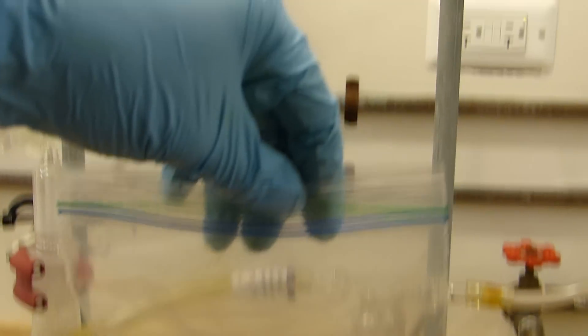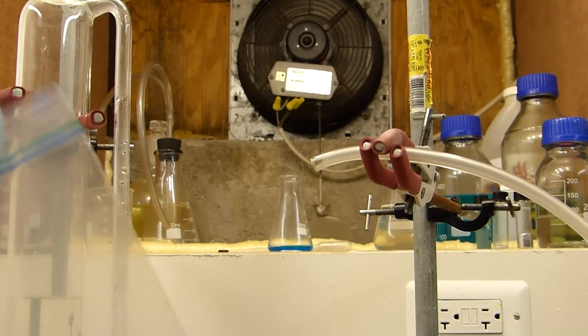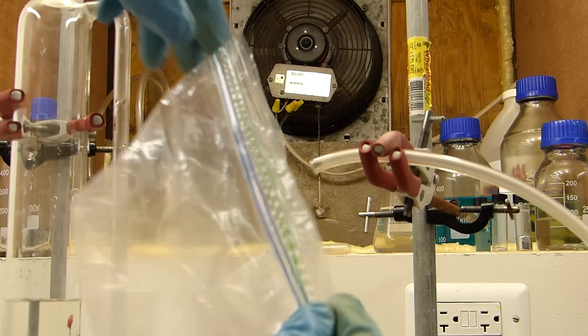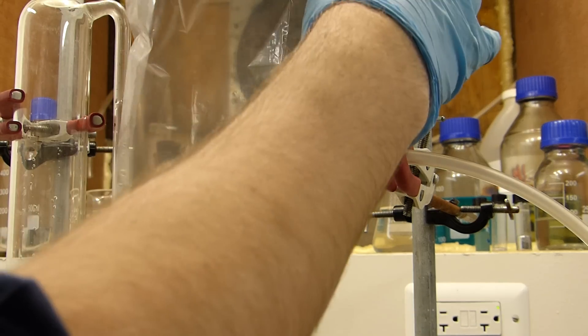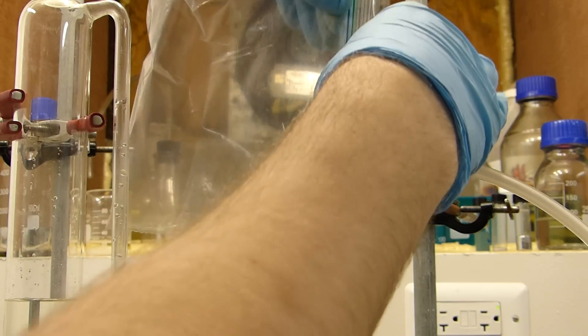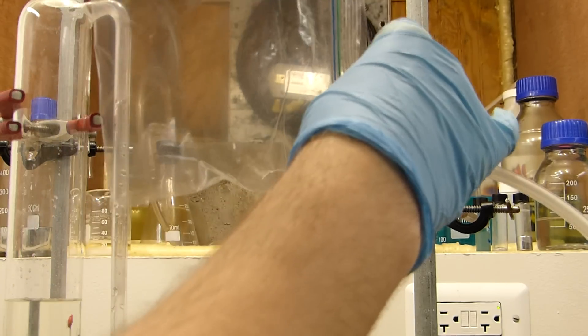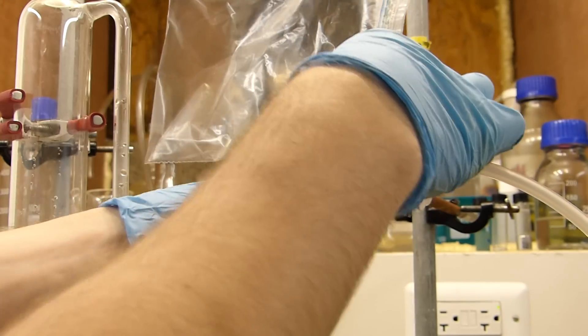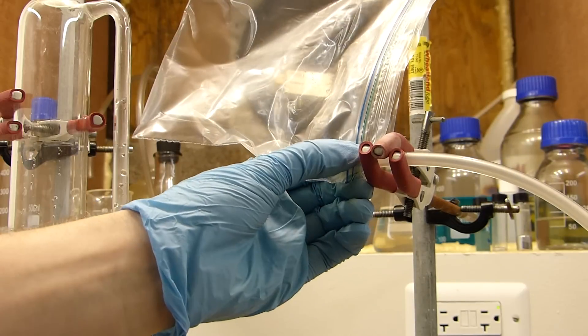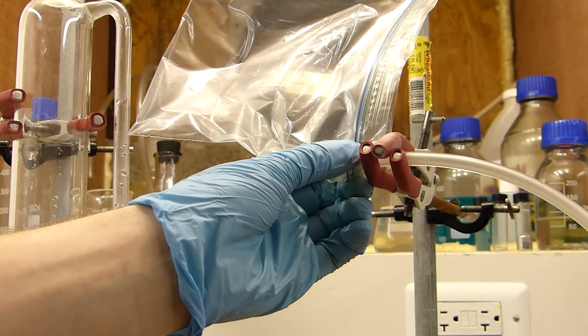All right, so I'm going to try and make a hydrogen filled sandwich baggie and see if it'll float. Now hydrogen is much more buoyant than air, in fact it's more buoyant than helium even, so I don't know if it'll have enough buoyancy to lift the sandwich bag but there's only one way to find these things out. Hold it on there and I'll just start the flow of hydrogen.